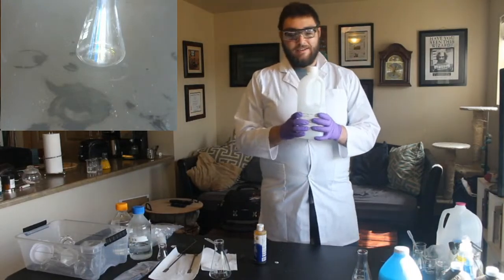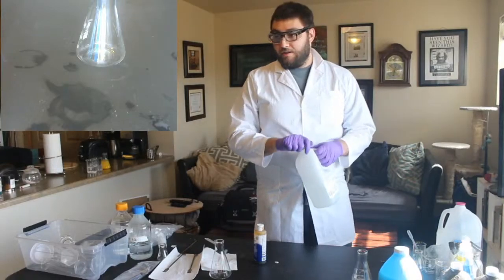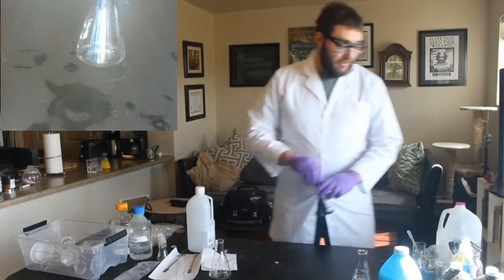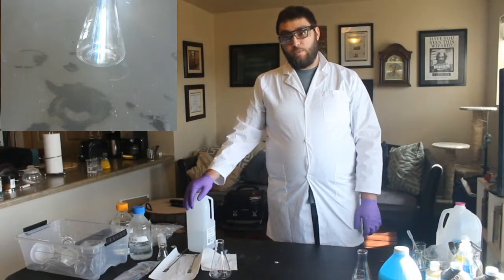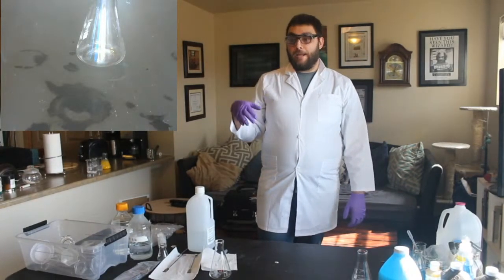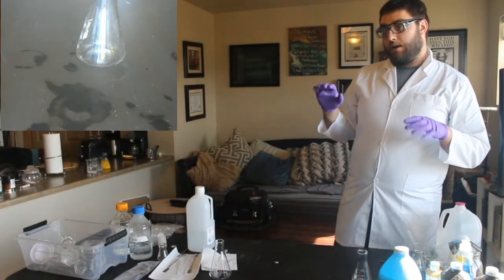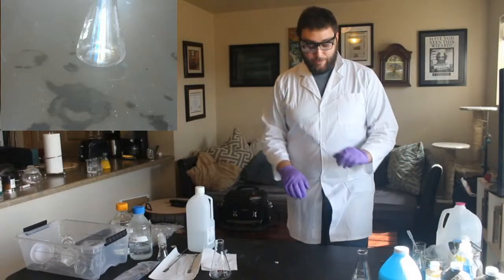So this is kind of old, so because it's old, it might have dissolved. Yes, Mark Rober did do this. He filled a swimming pool full of this stuff. Hydrogen peroxide at really high percentages, which is 30 to 35% is your max, starts to degrade over time. So because this is a little bit older, it's somewhere between like 20 and 30%. So we're not exactly sure.